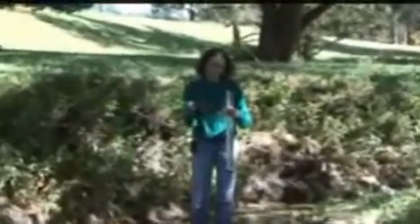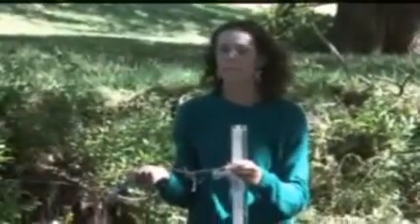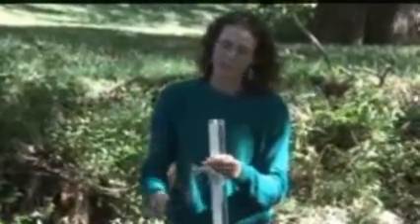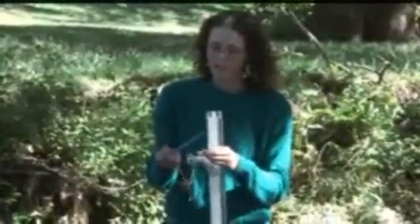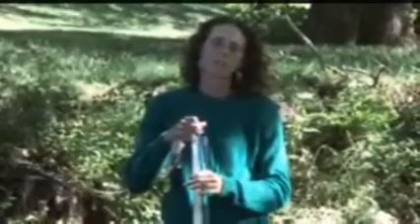Since your temperature is most accurate streamside, we usually just take our thermometer with us. This one has a string attached to it so that if you were to drop it in the stream, it wouldn't end up lost 20 miles downstream. The easy way to do this is just go ahead and stick it in your turbidity sample and hold it there for a couple of minutes and get your temperature reading here streamside, where it's going to be most accurate and without having to dump it in the stream.